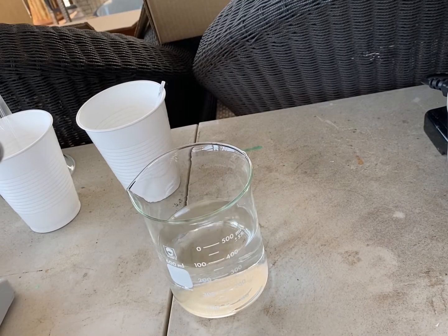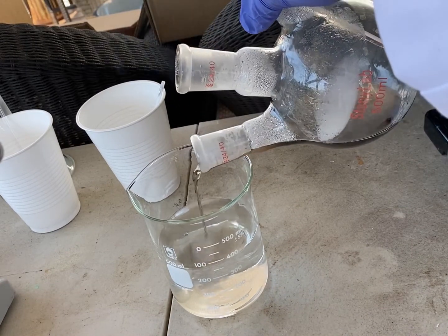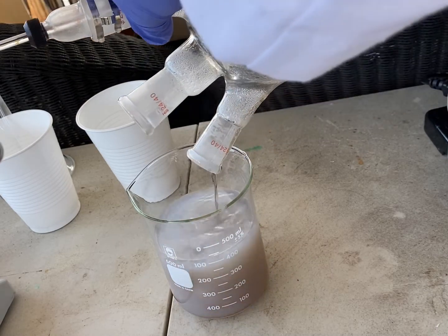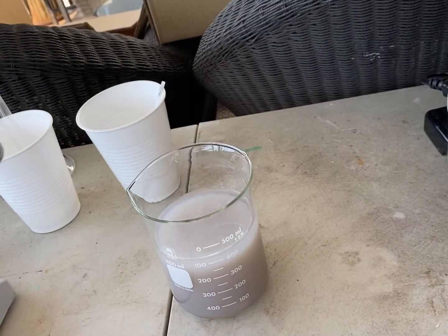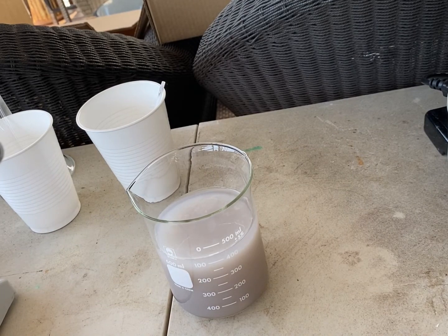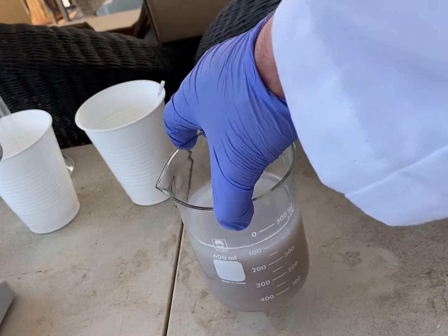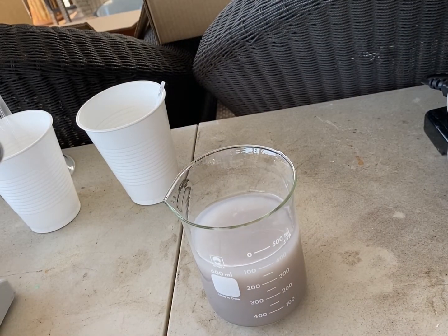The apparatus has been disassembled, and we're going to pour the solution into 350 mLs of water. It was let to cool down to about 140 degrees C, and now you see there's a precipitate. That's our naphthalene 2-sulfonic acid. Pretty cool, right?